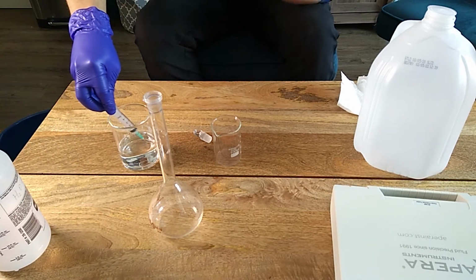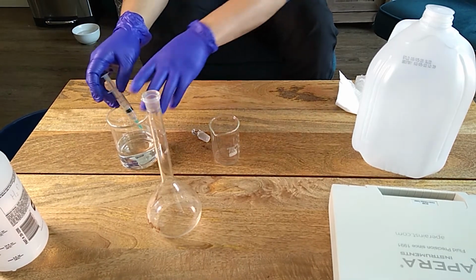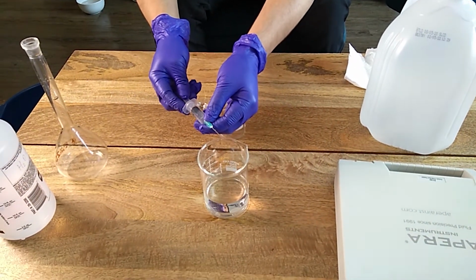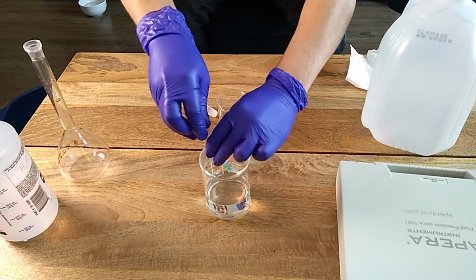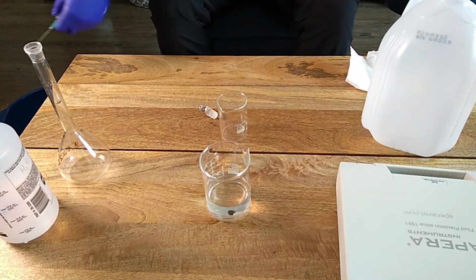As we normally do, we'll put a little bit here and purge the syringe. Just take three small ones, drawing the entire syringe so that you purge the entire volume.